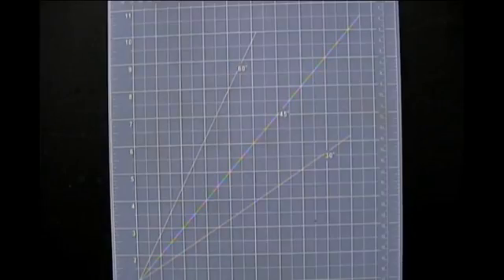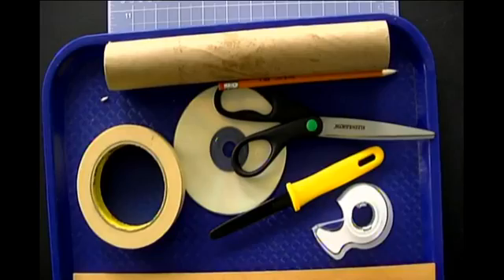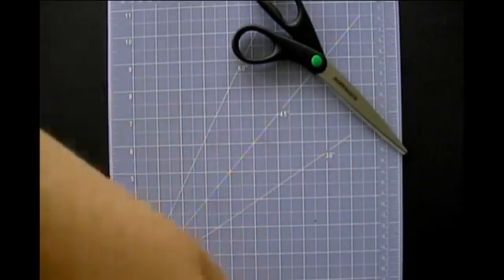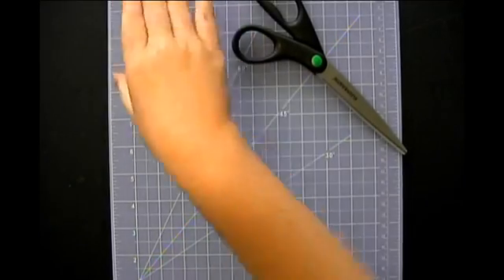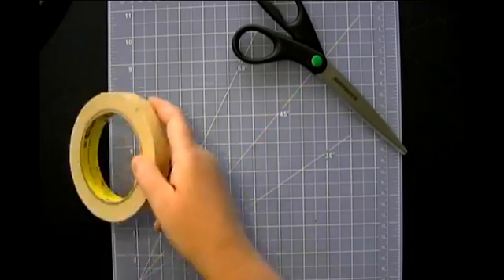All right, so let's go ahead and build this. I'm going to switch back to my document camera. Here we go. Got our supplies. We need our scissors. I'm just going to turn on the light here so you can see a little bit better. I turned it off for the other thing, but maybe make that a little bit easier. I need a better light. I say this every week, don't I? Every single week I'm like, I need to get a better light for my document camera. And yet every week I don't get a better light. What are you going to do?